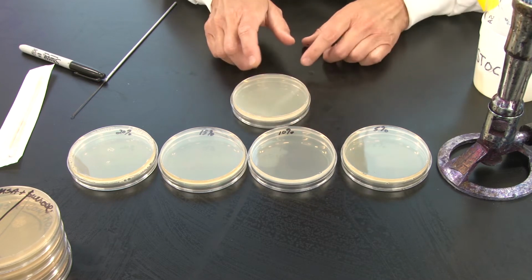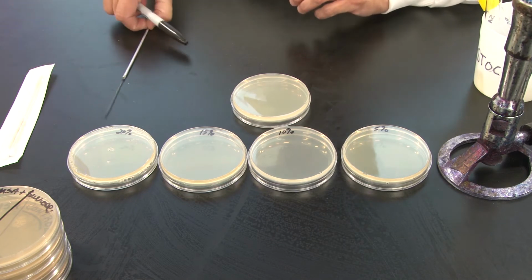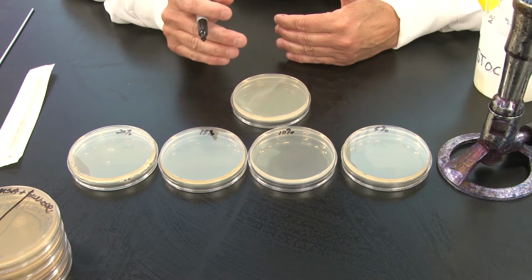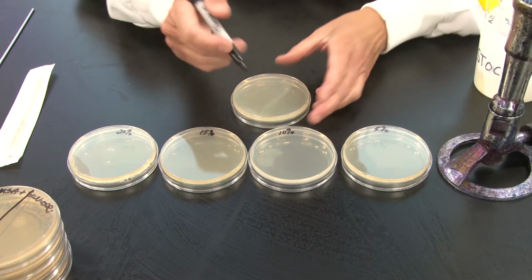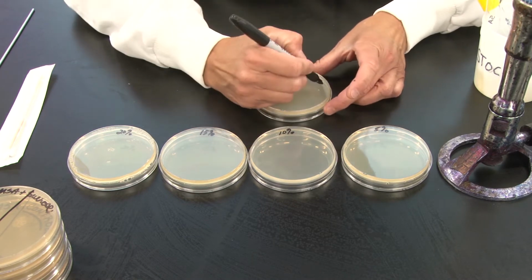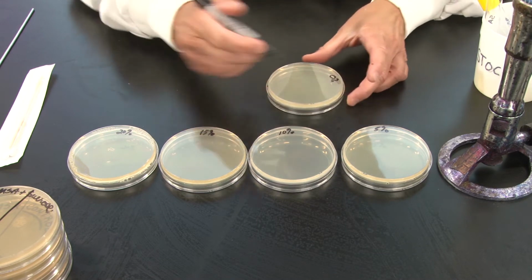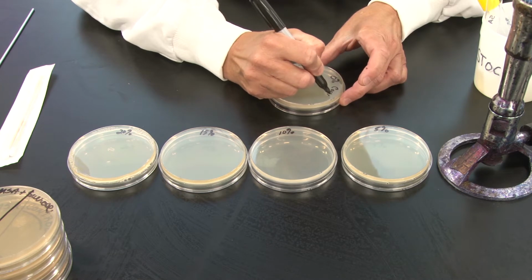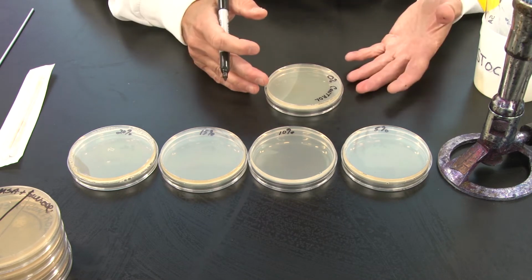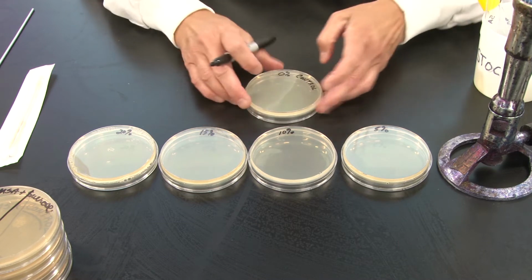I have included here a nutrient agar plate. We made a lot of nutrient agar plates in that session as well. I told you at the time that in this class, if you do not see a label on a plate, you assume that it is nothing but nutrient agar, so this does not have any sodium chloride in it. I'm going to label this 0%, and that is going to be our control plate because we know that both Escherichia coli and Staphylococcus aureus grow well on the complex medium known as nutrient agar. So this is our control.